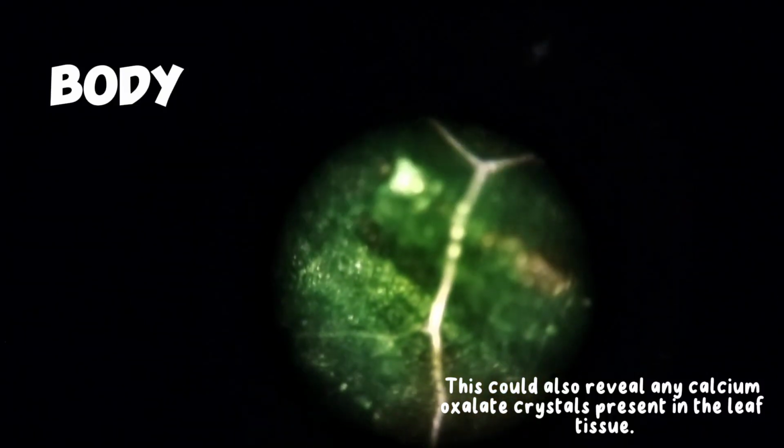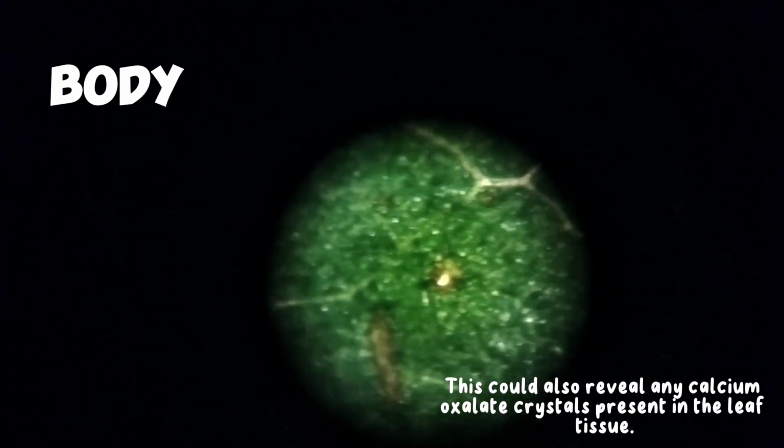This could also reveal any calcium oxalate crystals present in the leaf tissue.